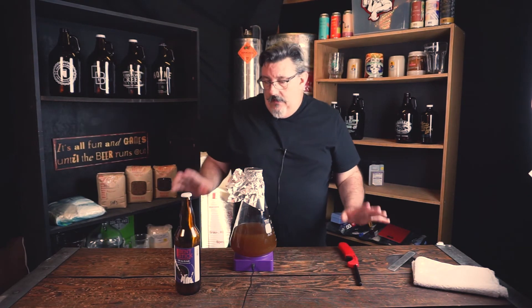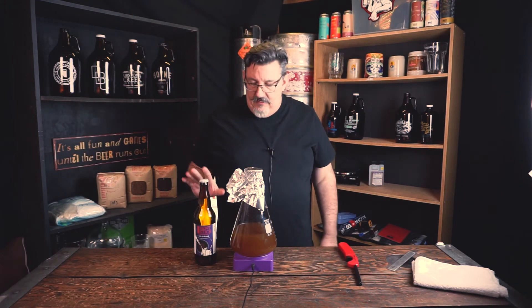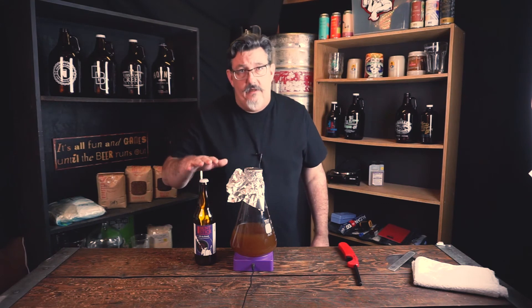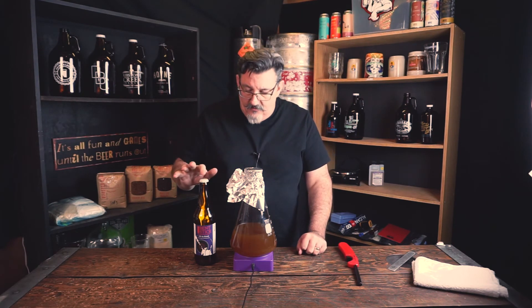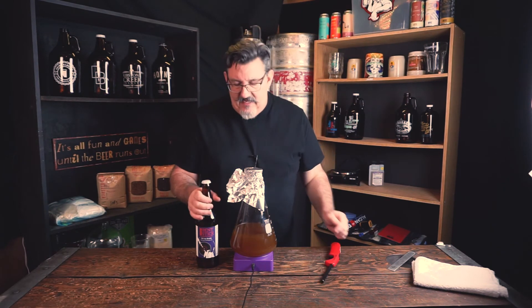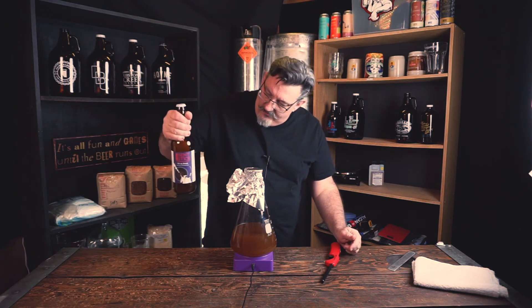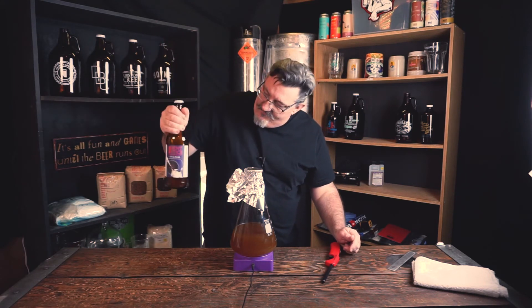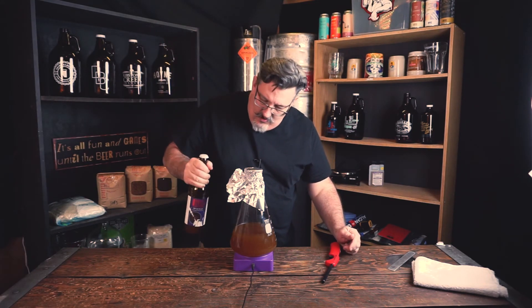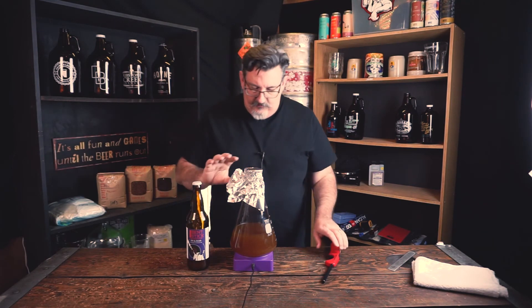This bottle has been sitting in my fridge since I opened the beer. I was cautious to keep the cap clean — I didn't touch the mouth of the bottle — so it should be basically factory clean underneath the cap. I'm going to get that yeast swirled up in the bottom of this bottle so it's nice and cloudy. We don't want anything sticking to the bottom, because everything we can get out of this beer needs to be in suspension.